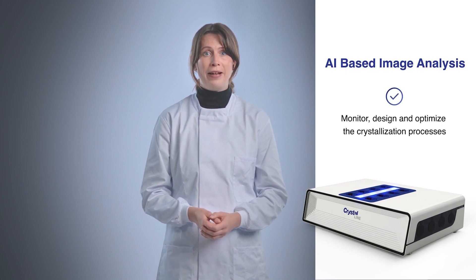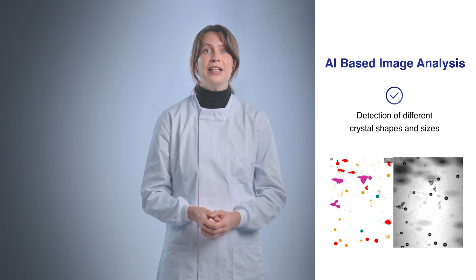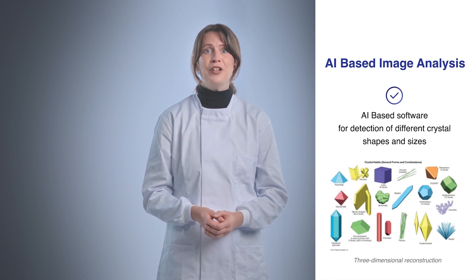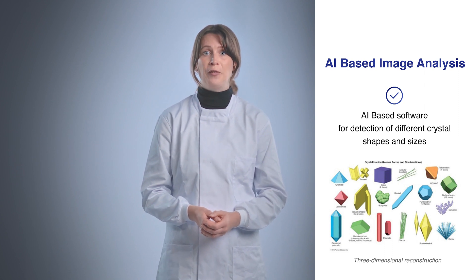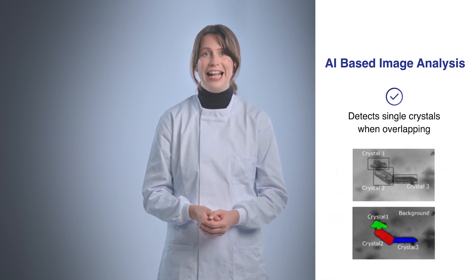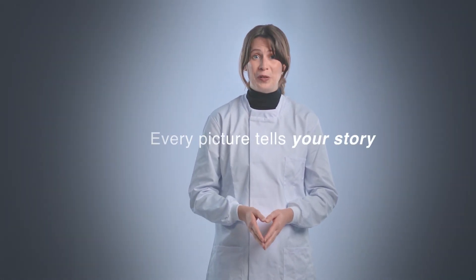The software allows the detection of different crystal shapes and sizes. The user can routinely classify crystal shapes into different shape classes and obtain three-dimensional reconstruction of the crystals. Overlapping particles are history. With the Crystalline version 2, every picture tells your story.